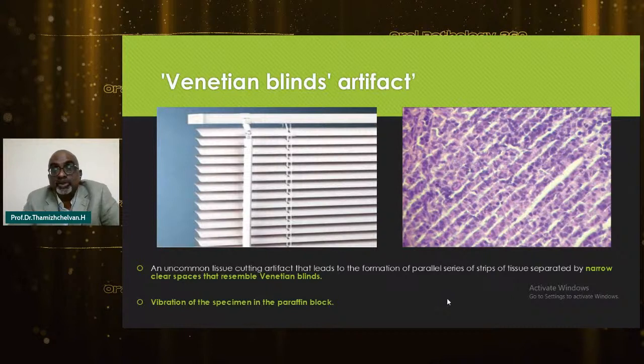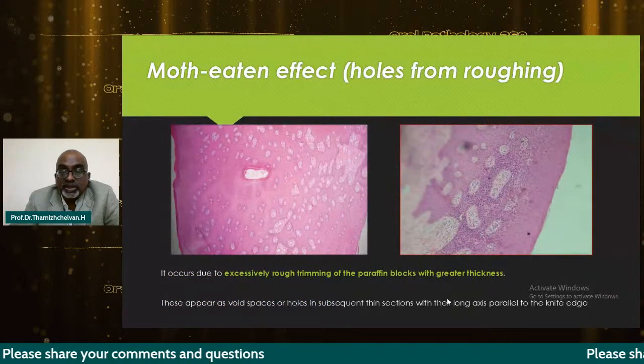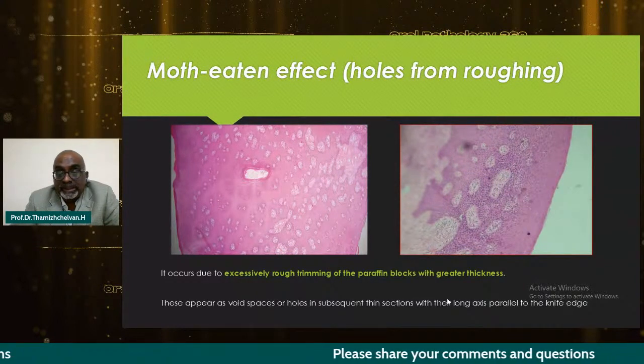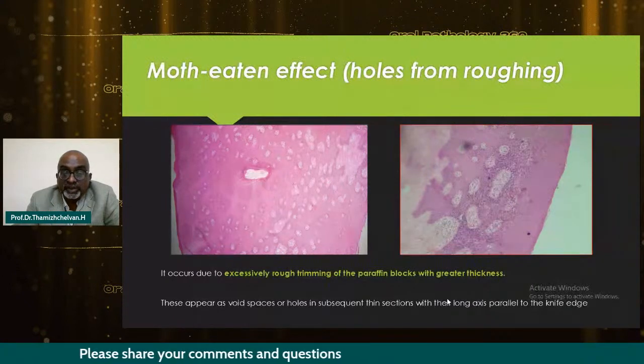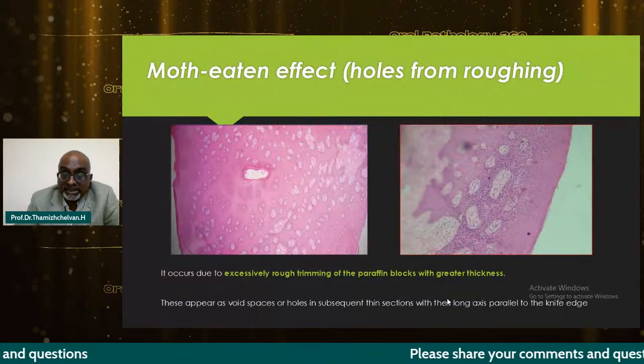Additionally, blade vibration artifact can also be seen in many of these cases because it happens day to day. What happens is there are little vibrations in the paraffin block and the section. So all you have to do is orient the tissue parallel to the blade. Moth-eaten effect refers to holes from roughing. It occurs because of excessive trimming of paraffin blocks with greater thickness. These appear as void spaces or holes in subsequent thin sections with a long axis parallel to the knife edge.